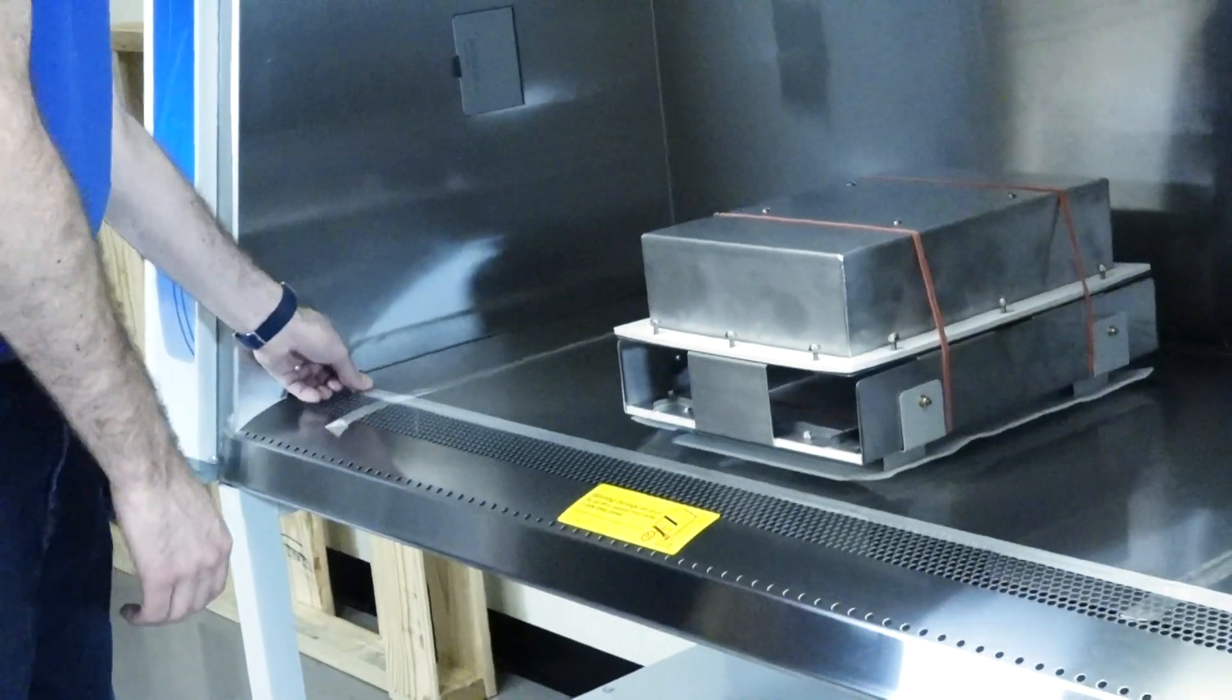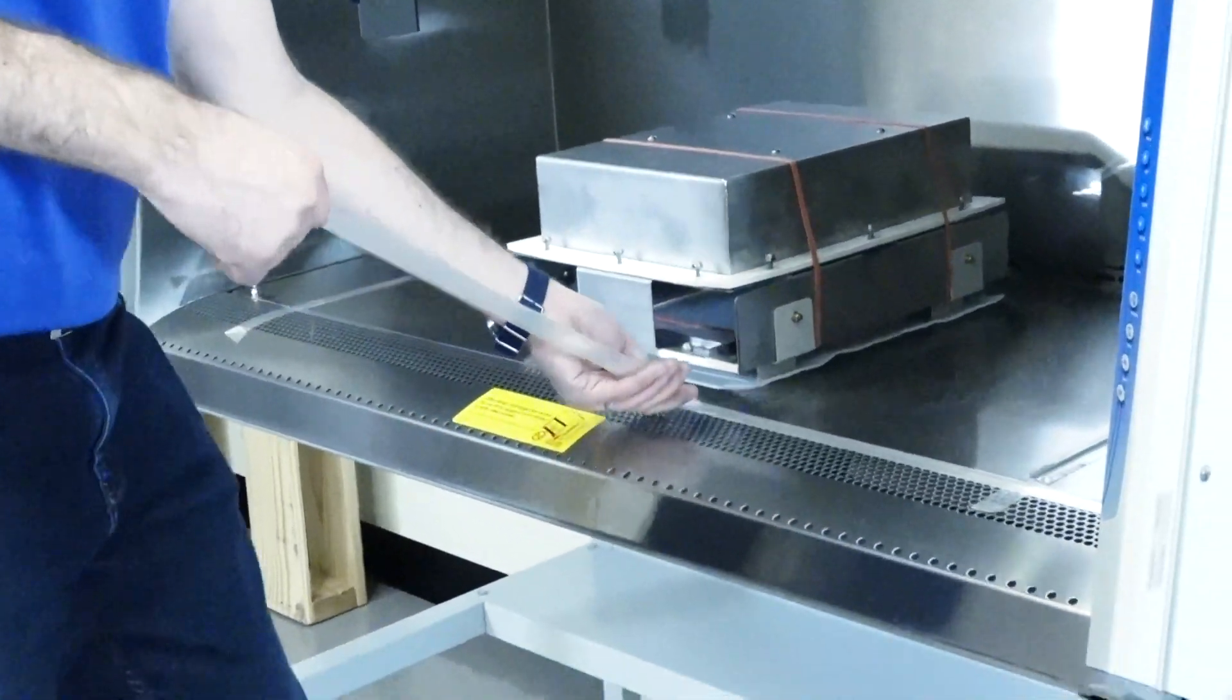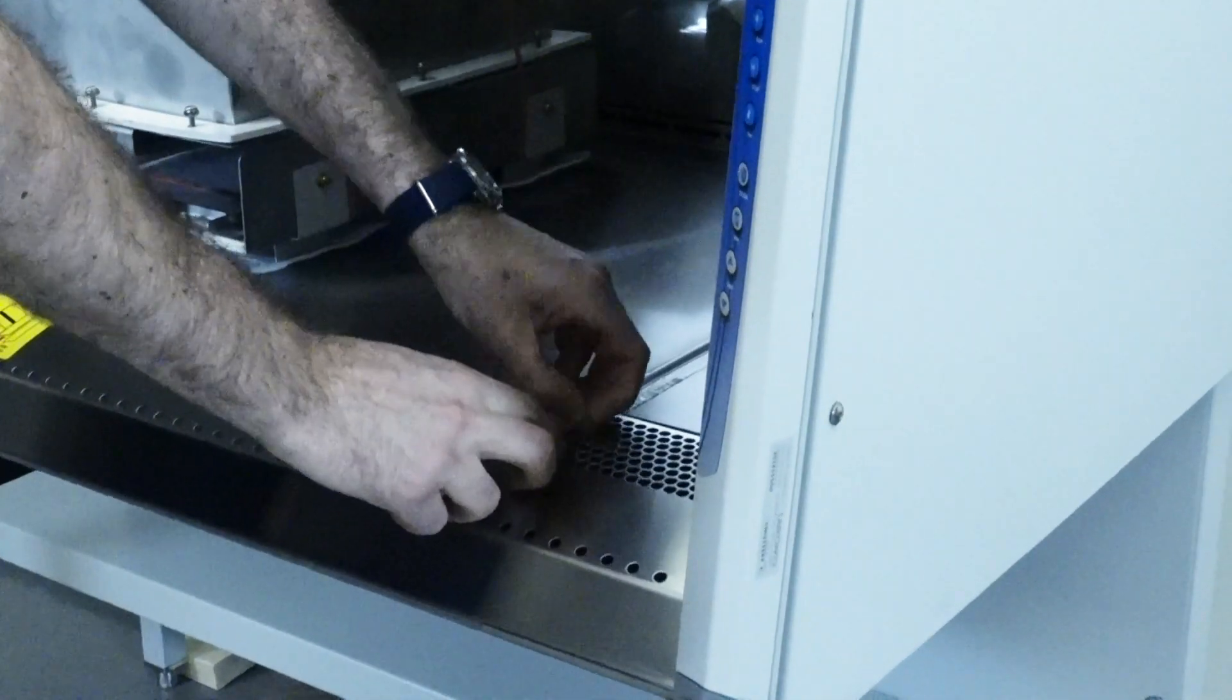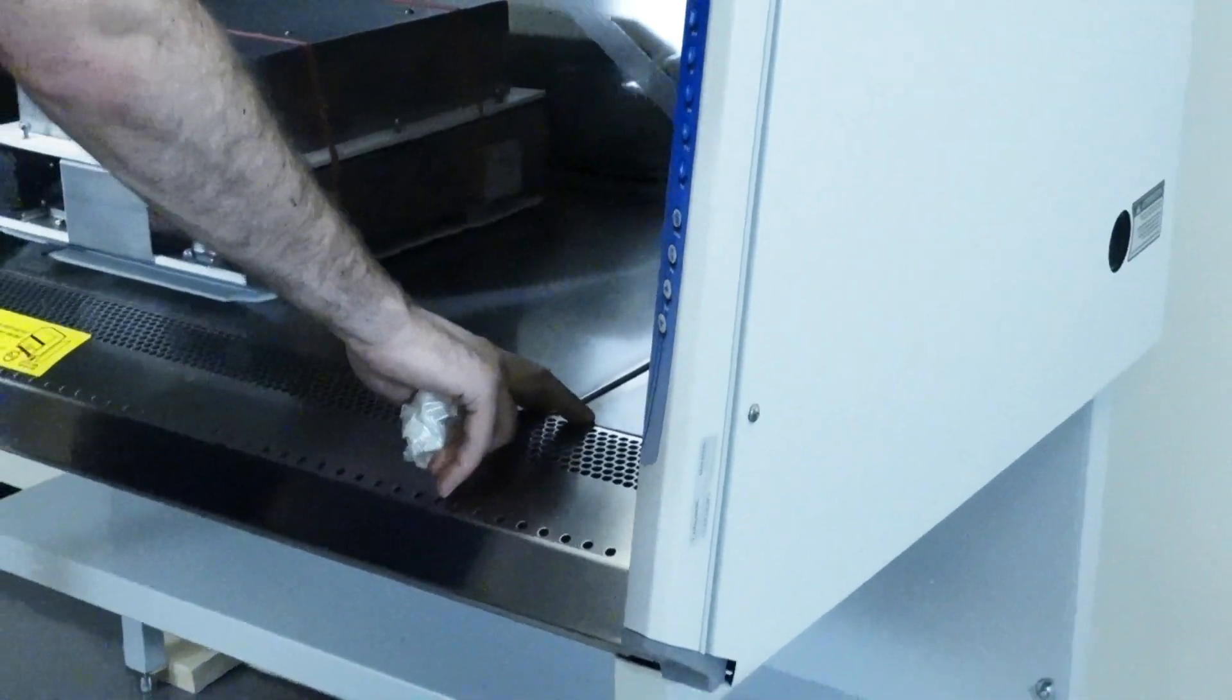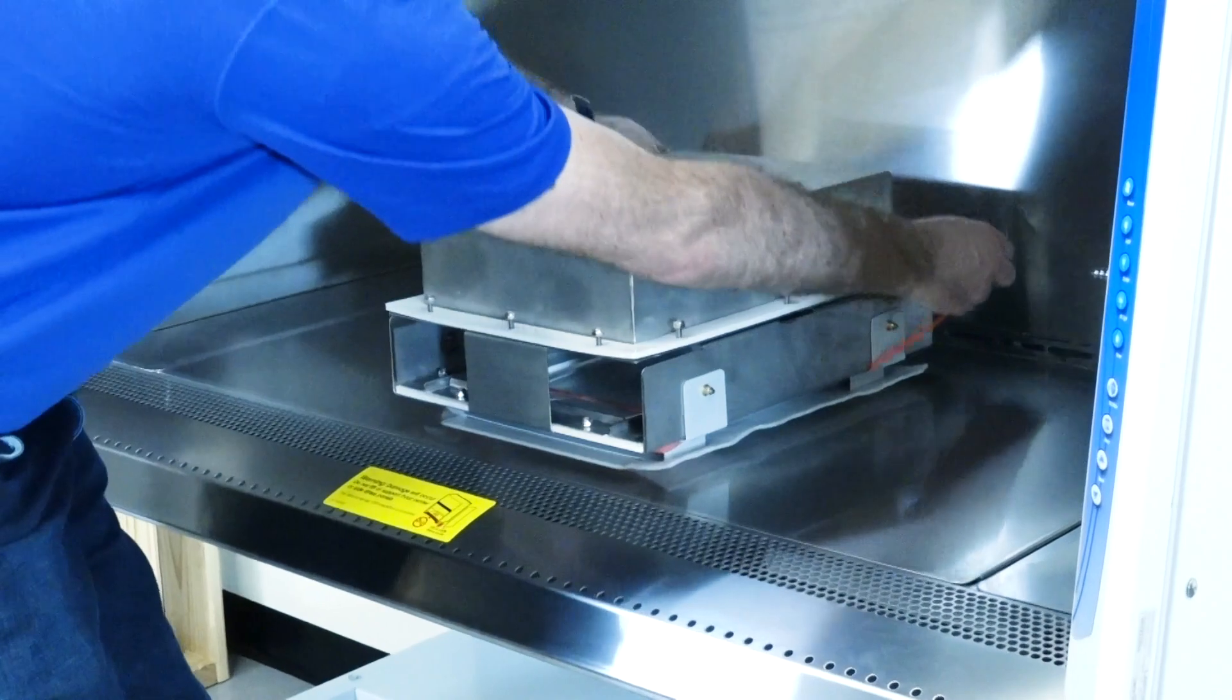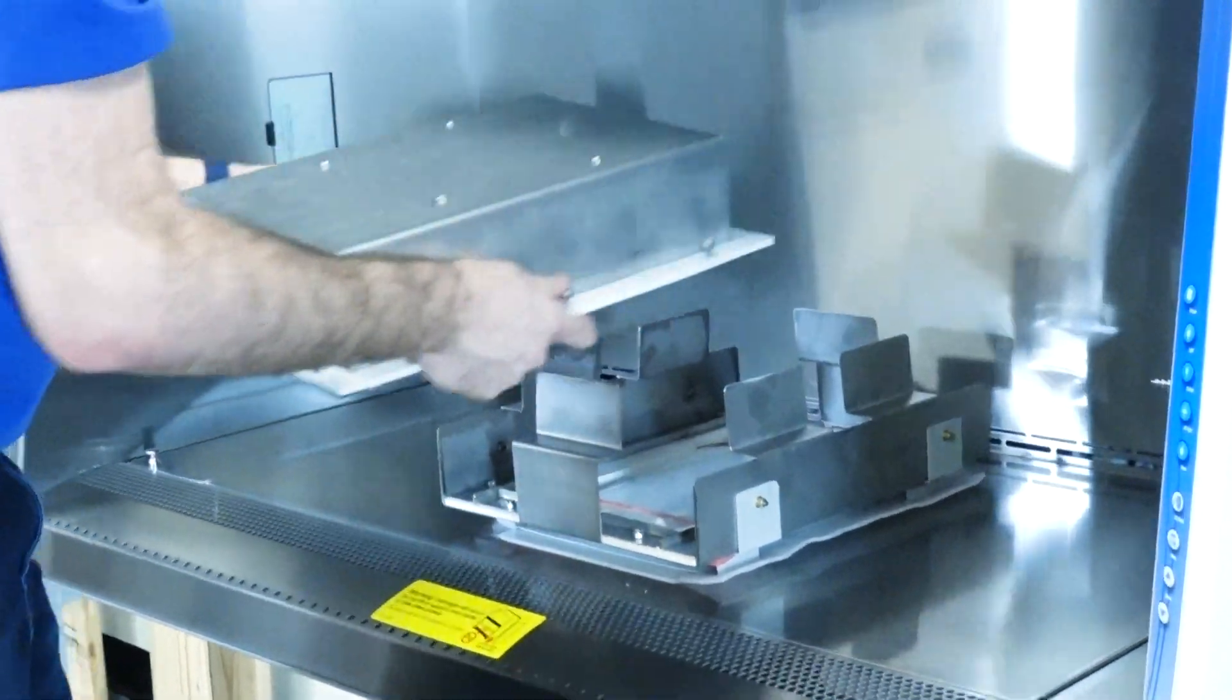Now we'll install the microscope sump into the Rebel Logic Plus. The instruction sheet outlining the following steps is included and should be carefully followed. Begin by removing the shipping bands. Then lift the inverted scope sump out of the biosafety cabinet.